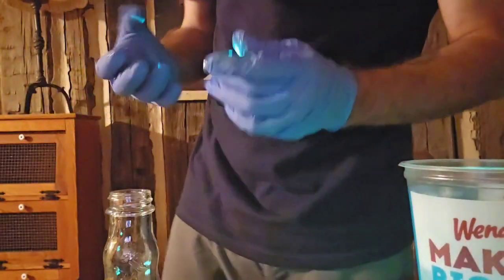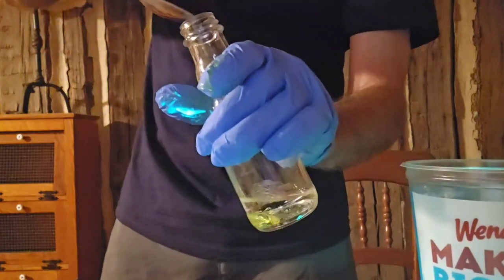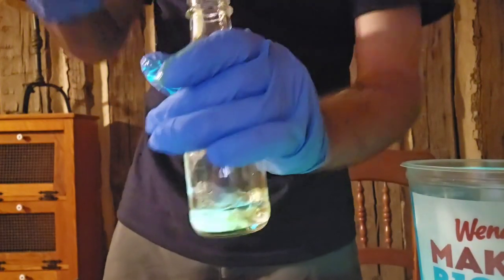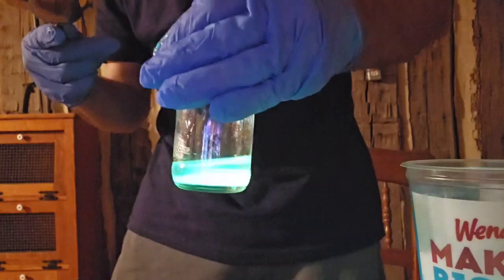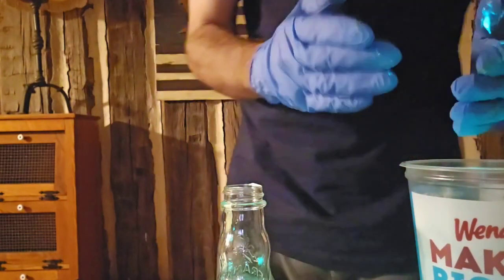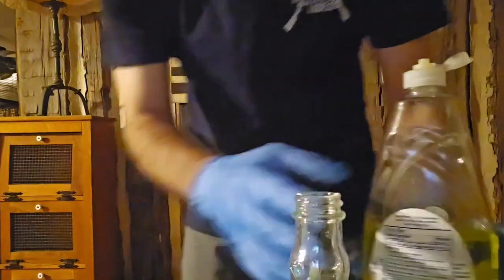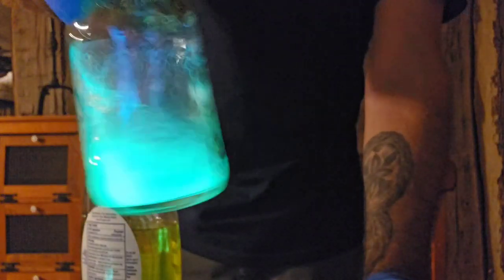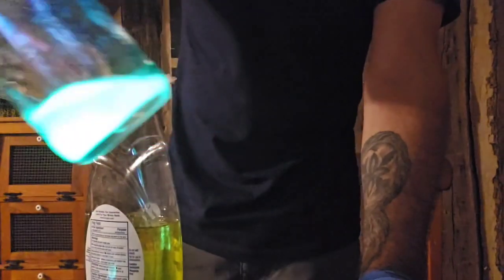So what we're going to do, we're going to put our baking soda in here, all right? Shake it around. Now look. She's a glowing, huh? Look at that. How cool is that, you guys? Ain't that awesome? Now, from what I've heard, give me 1 second here. I'm going to wipe this stuff off. All right, you guys. Now, look, like I said, shake it up. It's going to be all nice and there's your chemical reaction, okay? All right. How cool is that, you guys?